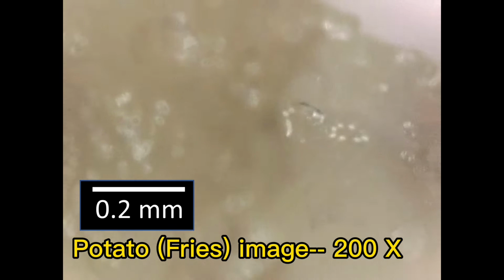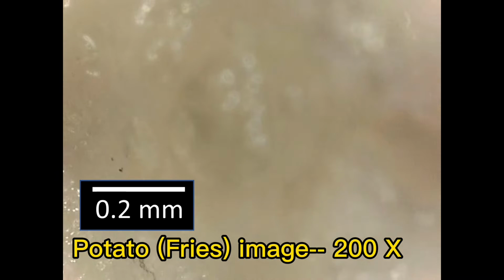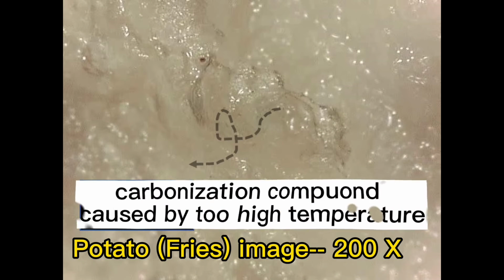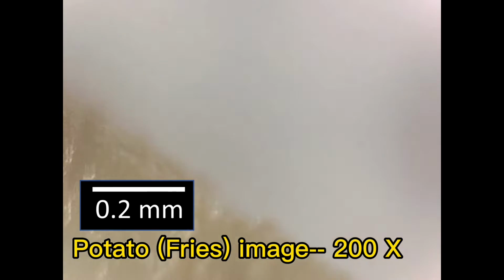Wow, it looks quite shiny and has obvious reflections, implying there are some oils on their surfaces. The black materials should be carbonization compounds caused by too high a temperature. Alright, let's throw in the citric acid and see what happens.